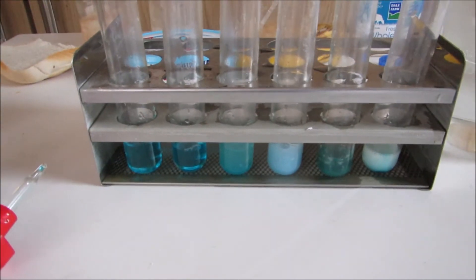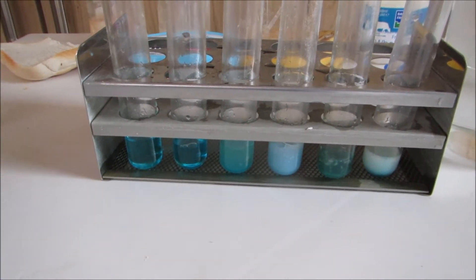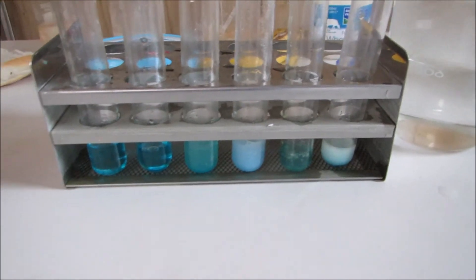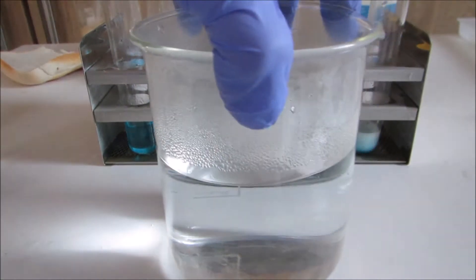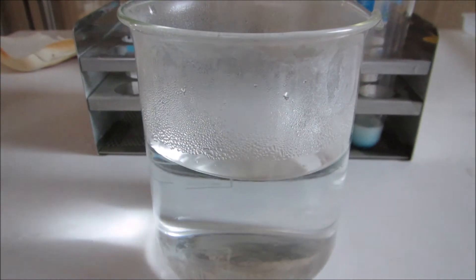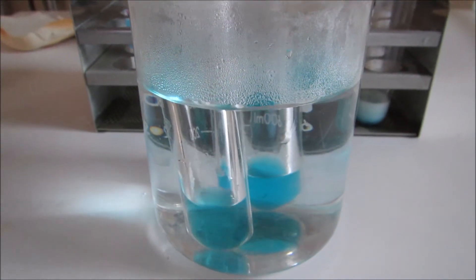If you look at all of them, they all look pretty much the same blue, but that's because to get the sugars to reduce, I actually have to add it to a hot water bath. So I have numbered all the tubes, but I'm just going to set them all in.